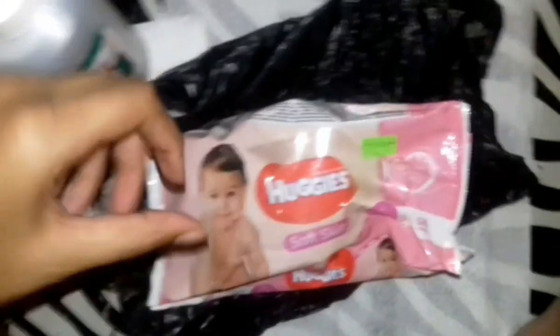Hello, today I am going to be preserving a wet specimen. You will need a jar, some alcohol — 70% — and an animal. Today I picked up a little bird that flew into the yard. I'm just gonna preserve it. I'm using a small jar because the bird I have is small.